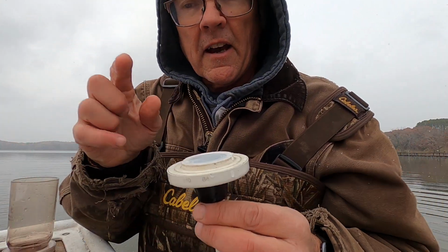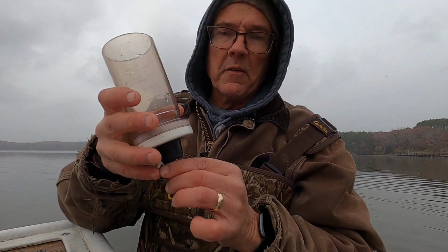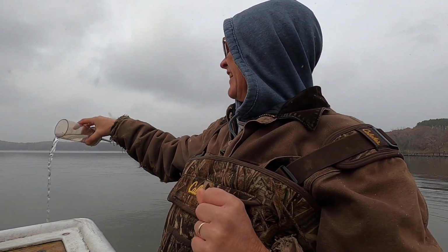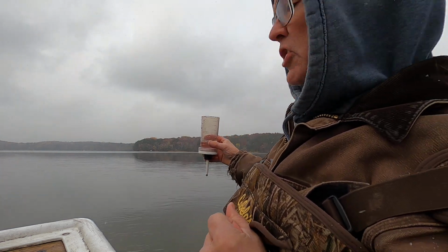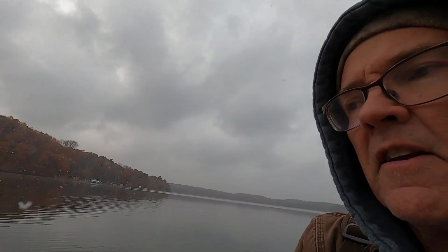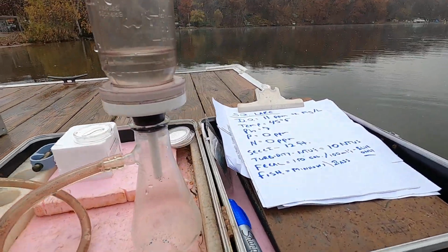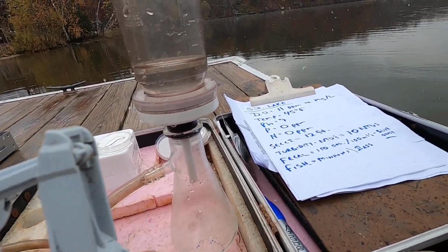We take a piece of sterile filter paper and put it on here. And this is magnetized. And we take exactly 100 mils of lake water, which is about that much. And we're going to hook it up to this. I'm going to show you how this works. The idea is we drag a known quantity of water across a piece of filter paper. So I'm going to create a vacuum by using this handle. And if you look carefully, you might be able to see water dripping out of that vacuum filter. And I'm dragging the water across the filter.